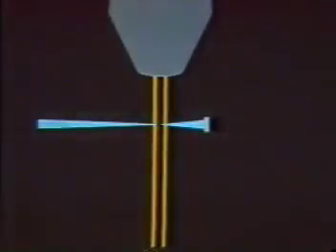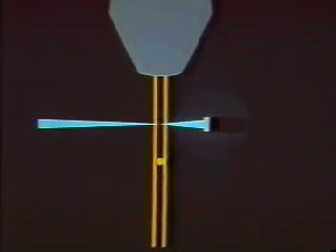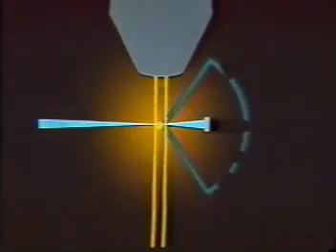If we could look inside the FACS optical bench, we would see individual cells flowing single file out of the FACS nozzle. As each cell passes into the laser beam, it scatters more or less of the laser light depending on its shape and size. In addition, if a cell has bound a fluorescent reagent or is intrinsically fluorescent, it emits fluorescent light in all directions.